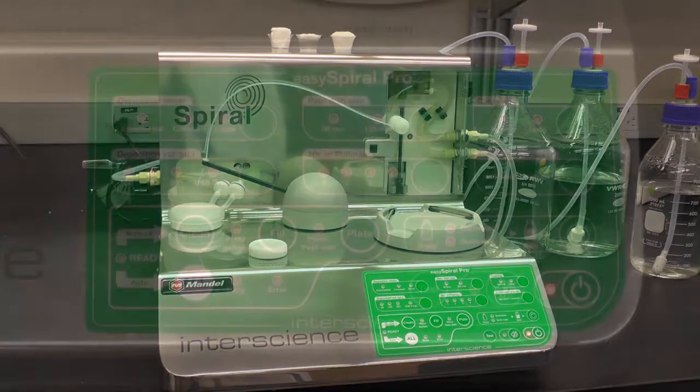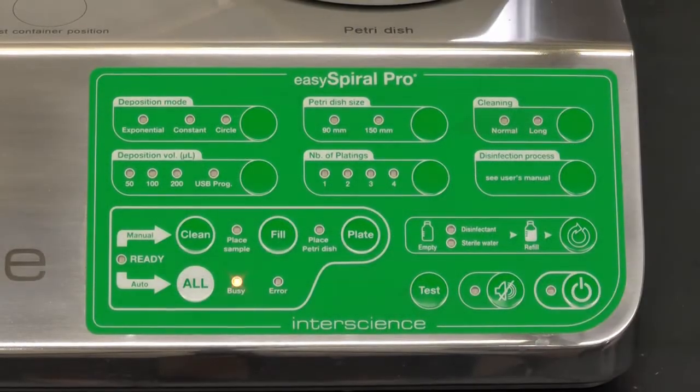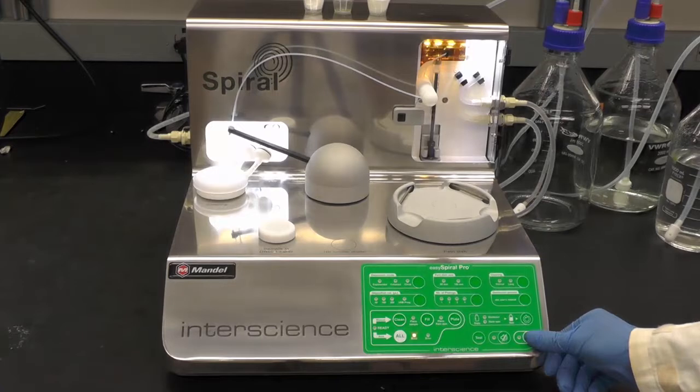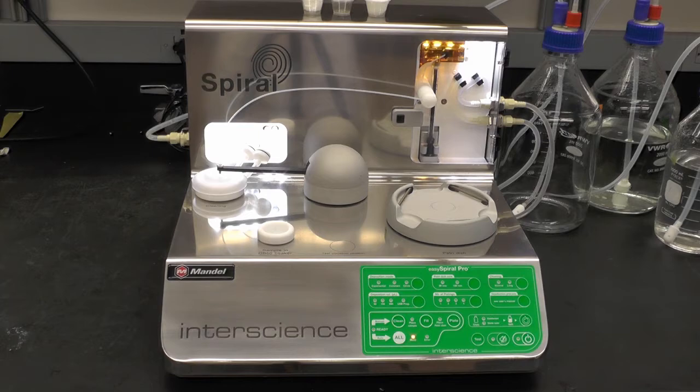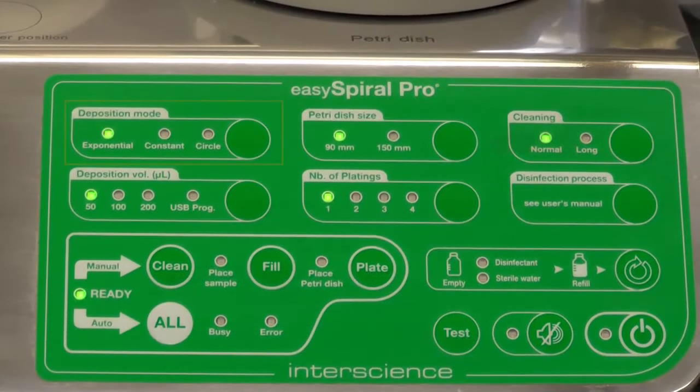Then press the power button at the front. The light will automatically turn on and the cleaning process will start. Wait until the cleaning process is complete and check the setting of the instrument.